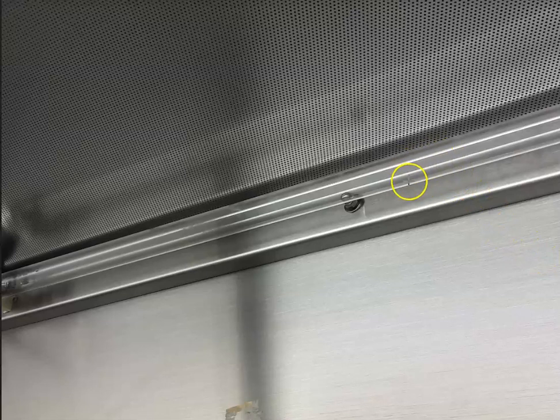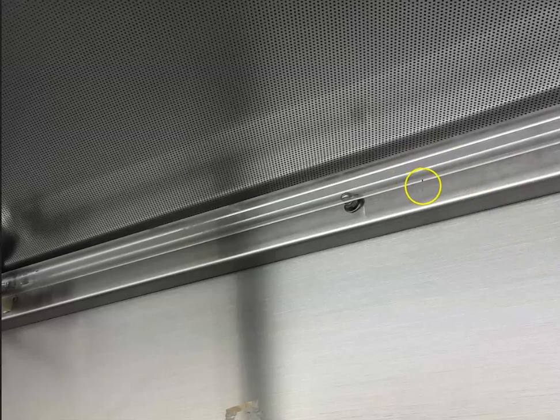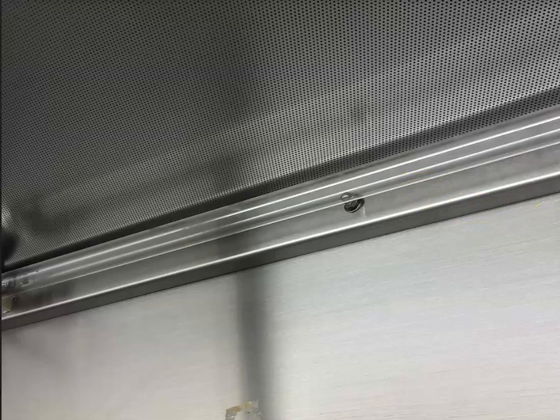If you look here you can see the ultraviolet light, which is turned on when the cabinet is being sterilized between operations.